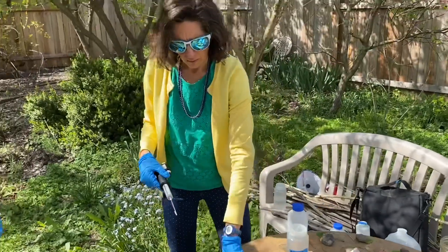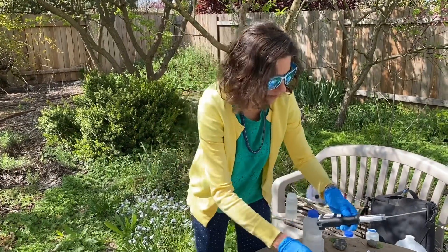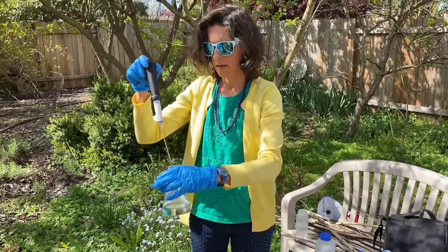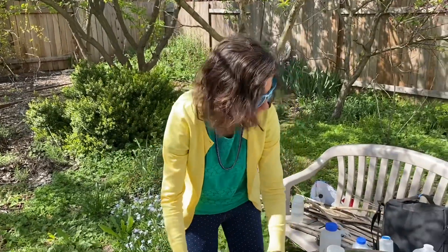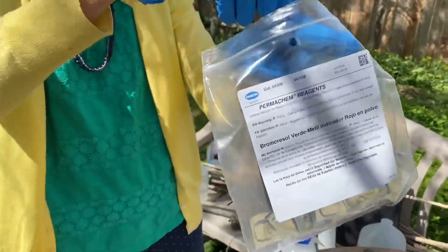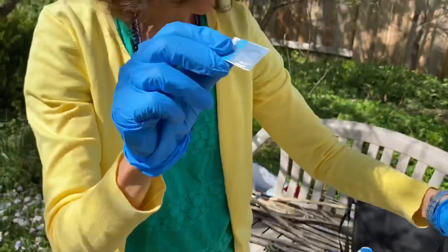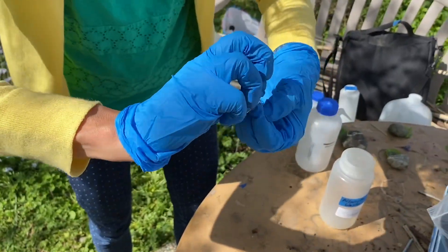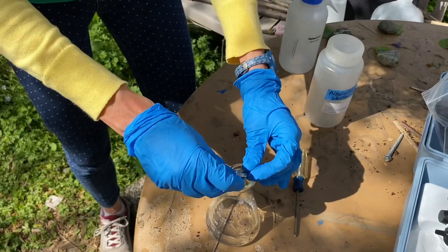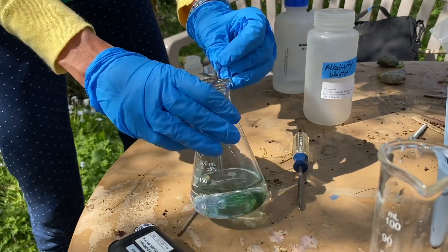I went with 100 milliliters and 1.6 normal acid, because that's what I think will work. So before we get going on this to titrate, we put in our color indicator, which is the Bromo Cresol Green — or Verde, depending on which side of the label you're using. So I get a little powder packet, and it's very hard to get these open with gloves on, but it's probably a good idea to protect your hands from this stuff.